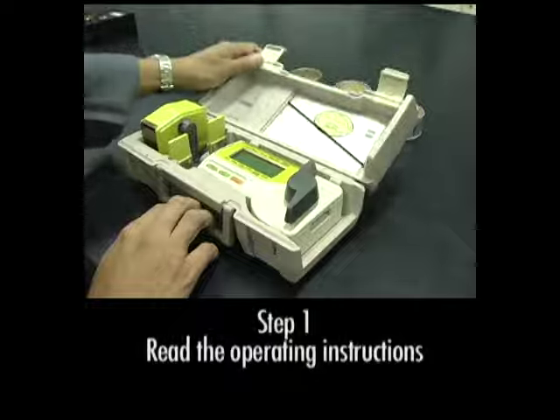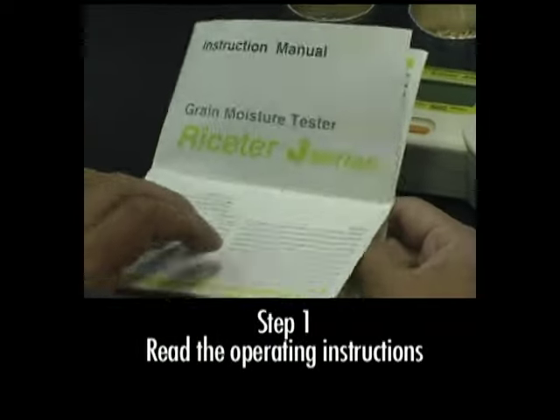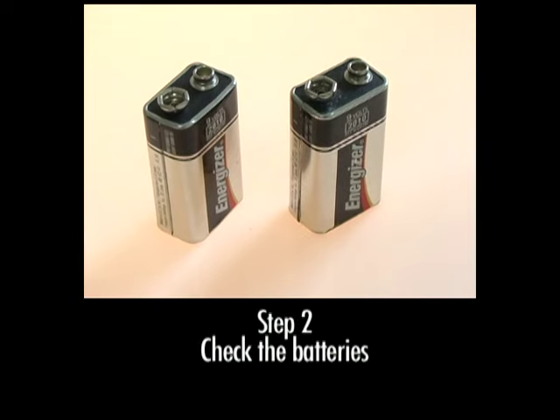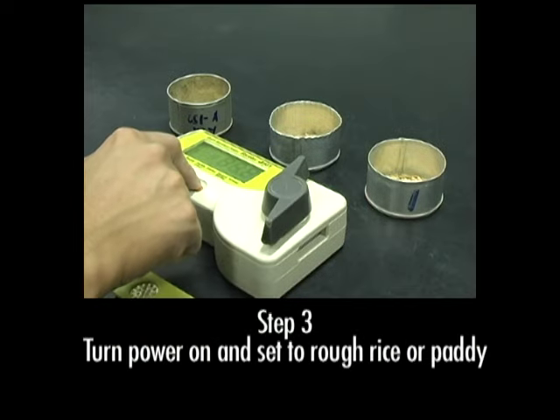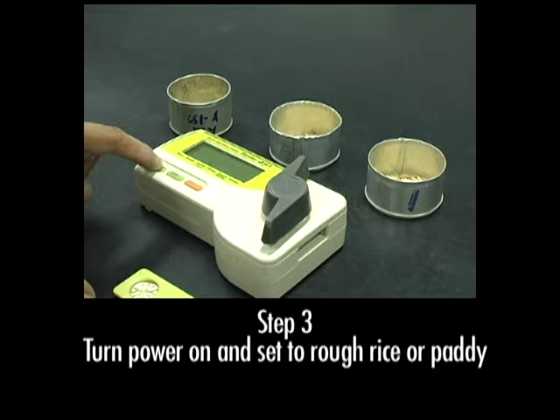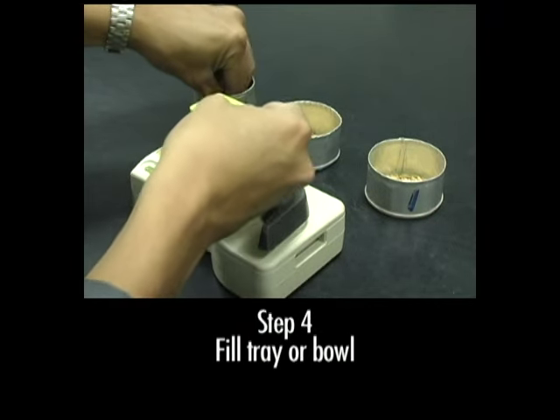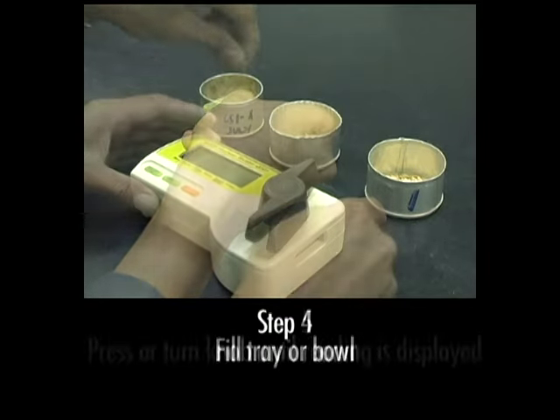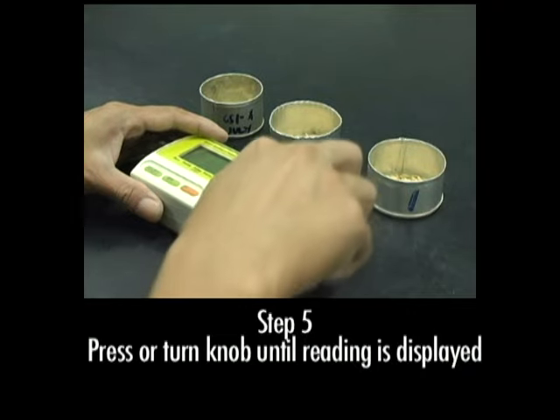To use a quick moisture meter, first read the operating instructions. Then check that the batteries are still good. Next, turn on the power and make sure the machine is set for paddy or rough rice. Then, fill the tray or bowl of the moisture tester with the paddy sample. Turn or press the knob until the moisture reading is displayed.